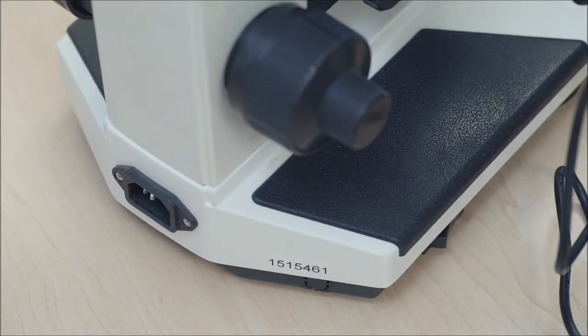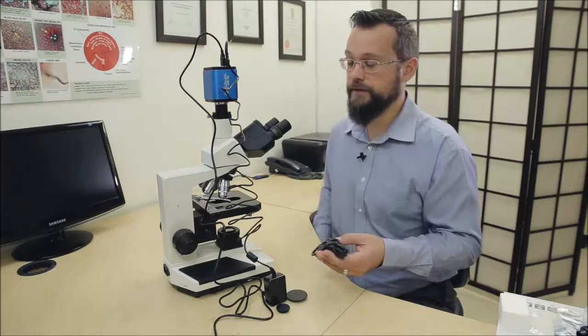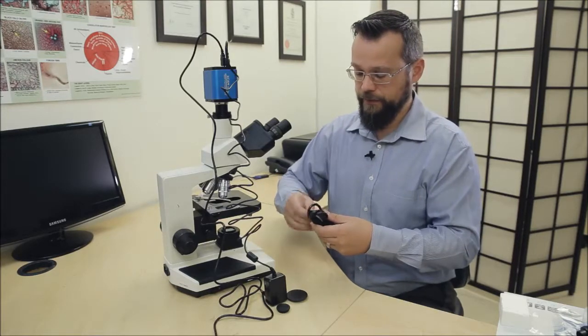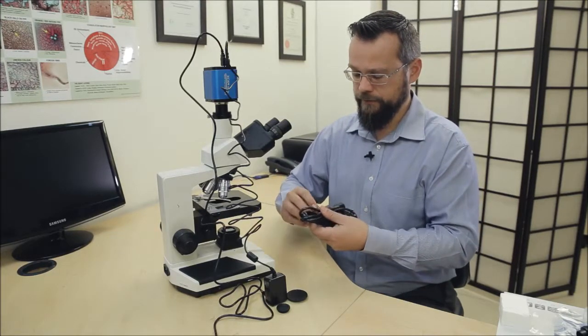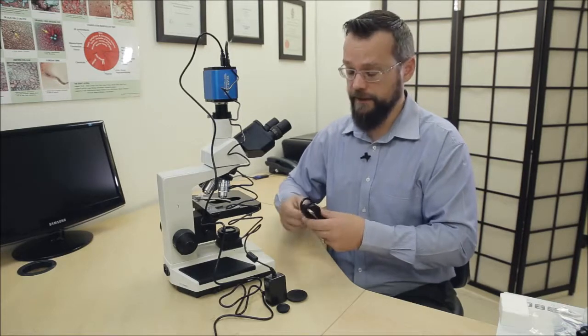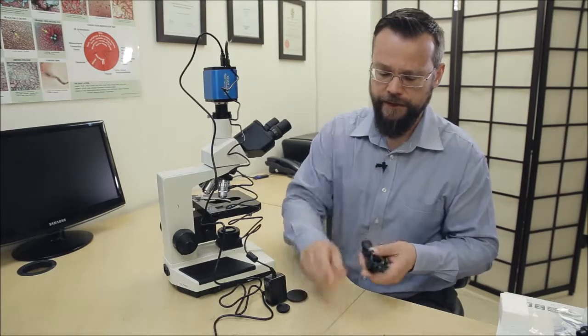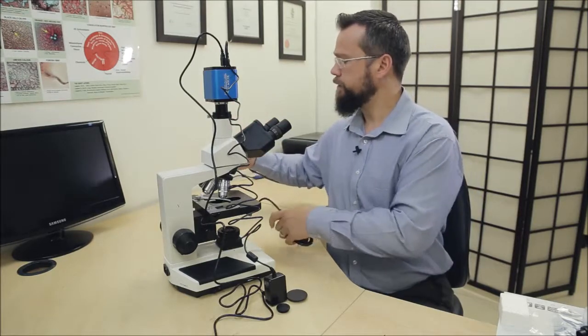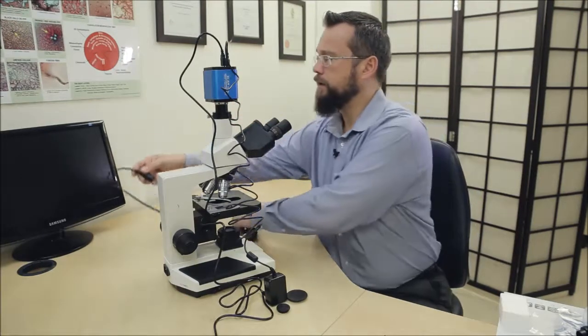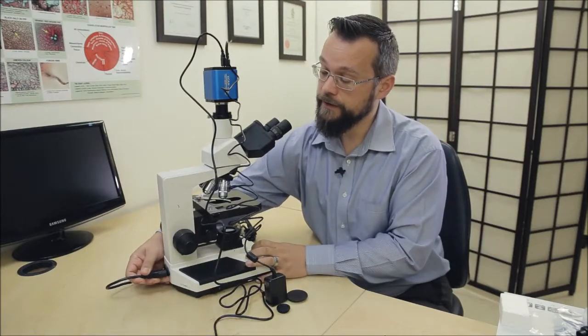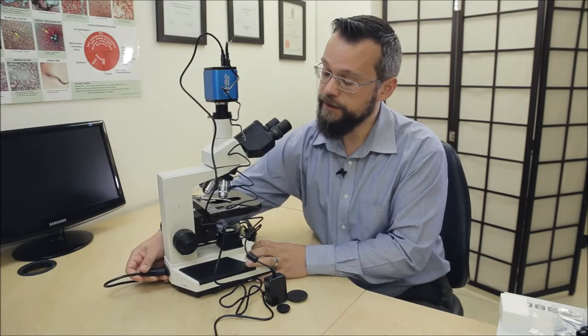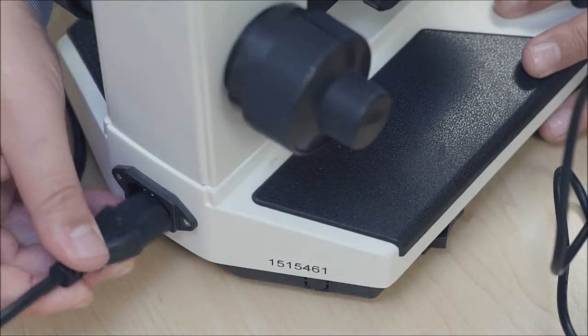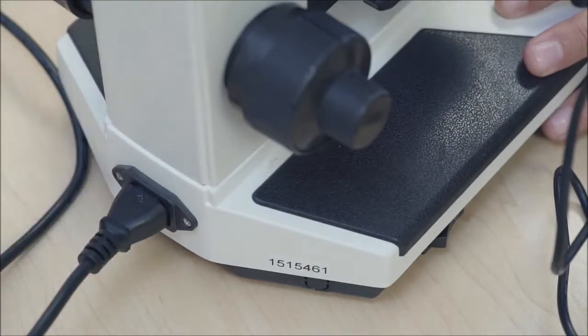Okay, and finally we're just going to plug the power supply for the microscope into the back of the microscope. Now if you are based in North America, your cables and plugs will be with the correct adapters. The system is compatible with North American power supply and anywhere else in the world we do send the correct adapters so that it works on the power supply that you have. So this really just fits into the back of the microscope, very simple, and plug it into place and there we are.